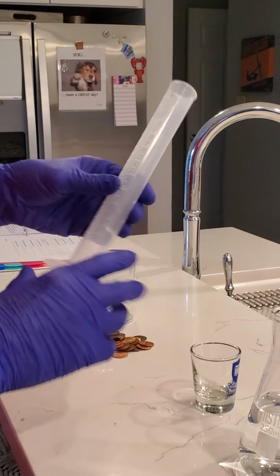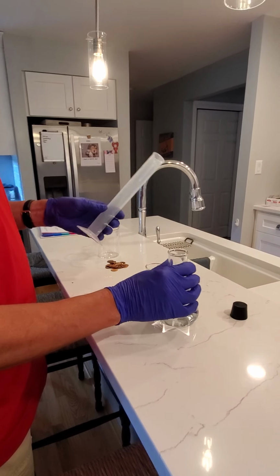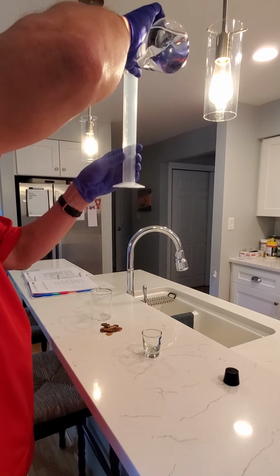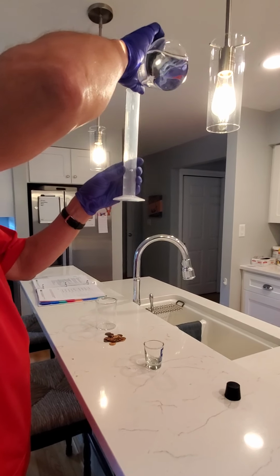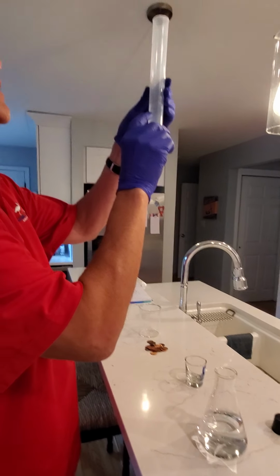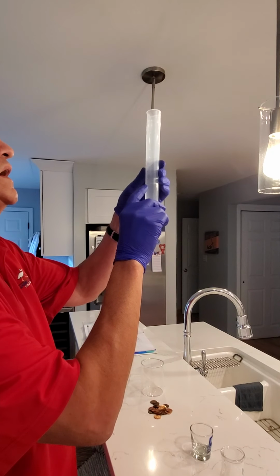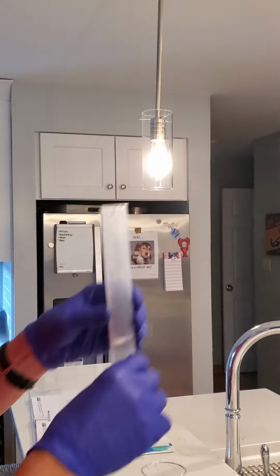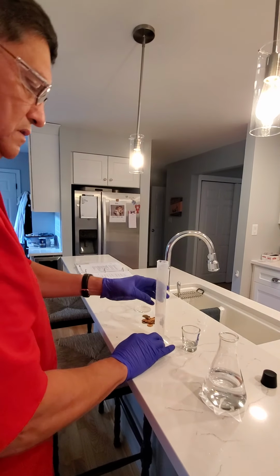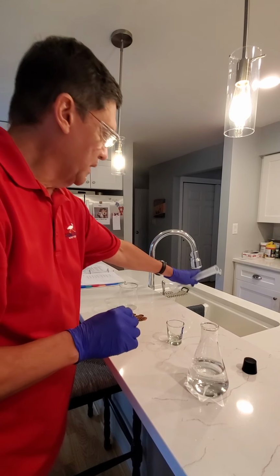And the one recommendation I make when using graduated cylinders is that when you measure a volume, you hold the cylinder even with your eyes so you can measure the volume and see directly rather than looking down at an angle. So in this case, I would read this at eye level, 35, 36, 37.5 milliliters. So it's easier than putting it on the bench and trying to bend over and read it rather than putting it at eye level. So that would be one direct method.